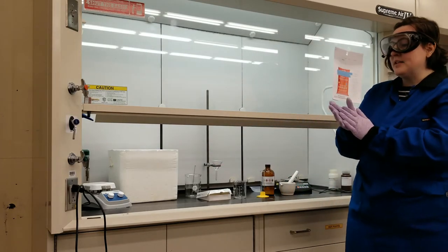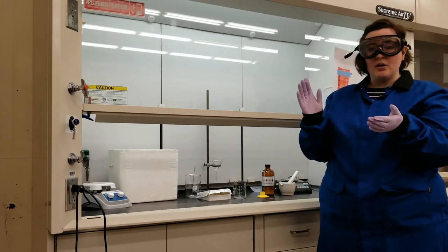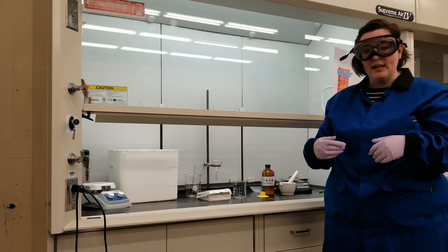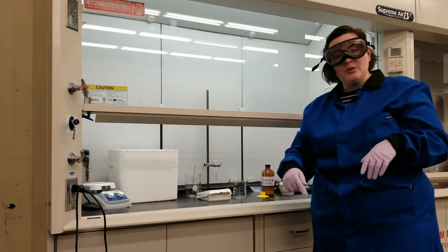A note about safety. Today I'm following proper safety protocols because I'm wearing splash-proof goggles, I'm wearing a lab coat, and my shoes cover my toes.